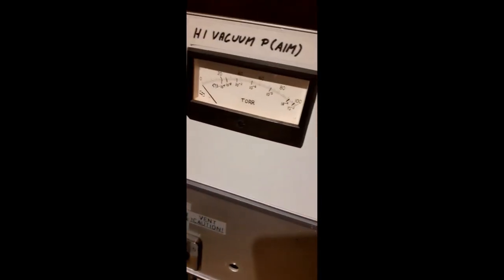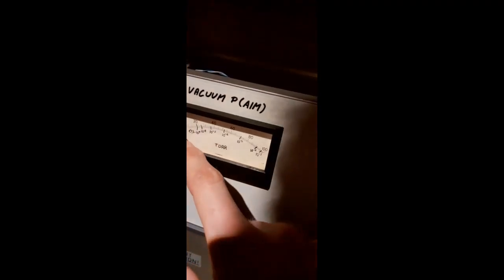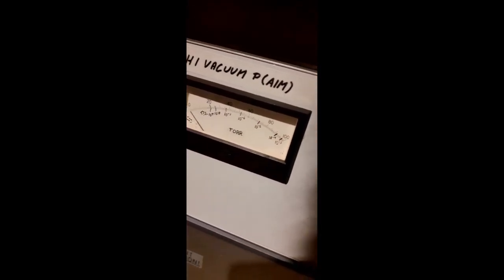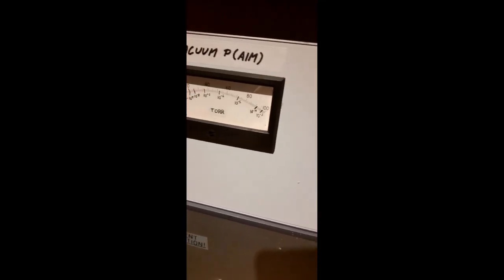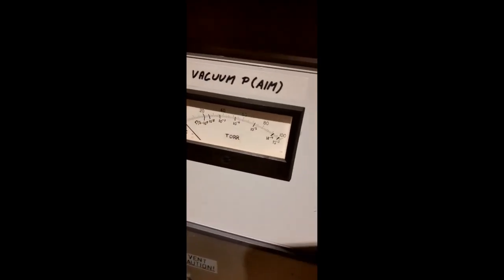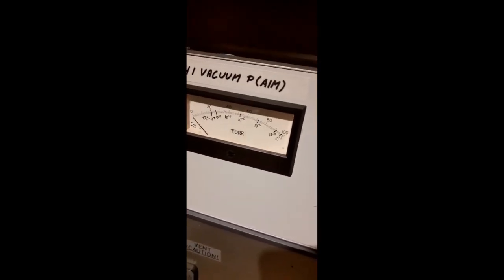This is the high vacuum gauge, that's this one, remember? And it goes all the way down to 10 to the minus 9th, I think. It excels over the glass hot cathode ionization gauges in that you can run it continuously. I mean, it's very robust. You shouldn't turn it on while there's no vacuum, but from 10 to the minus 4th torr, you're not really going to damage the gauge.